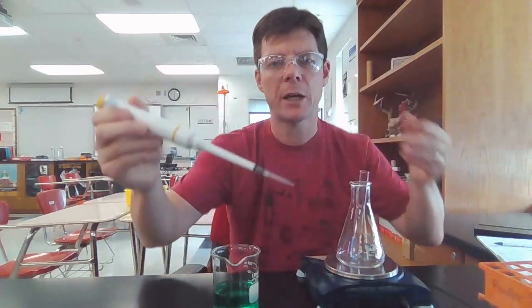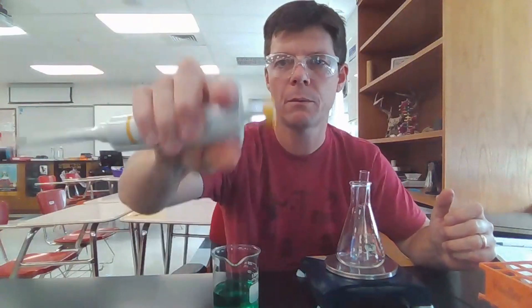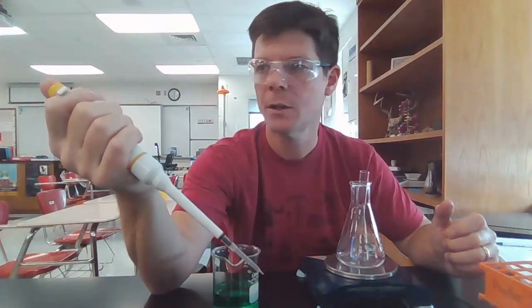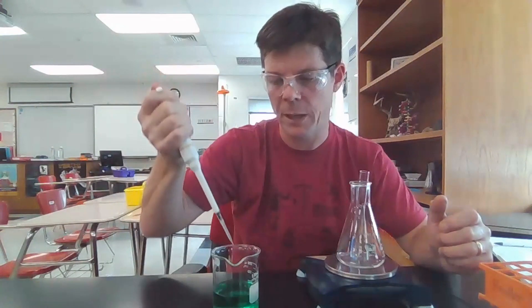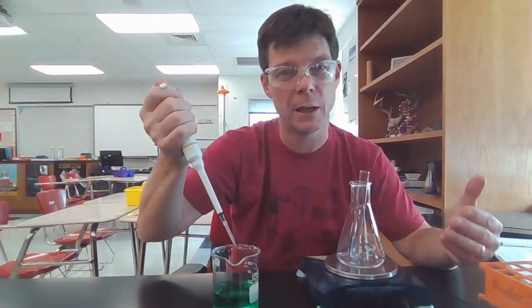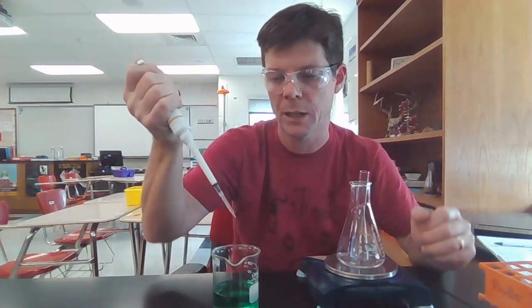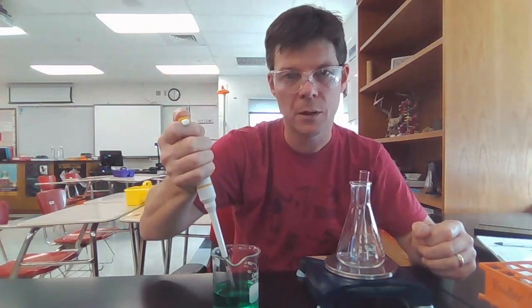When I'm using the micropipette for transfers, I'll hold it with my finger around the hook. My thumb goes on the plunger. I'm going to depress to the first stop point, then I'll place the micropipette into my liquid sample. I want to make sure it's completely under the surface. I don't want to pull any bubbles into my tip. So first stop into the beaker.